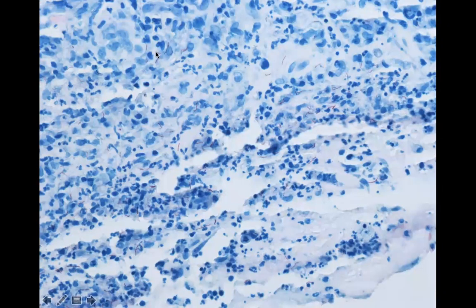And in this case, when we did the Fite stain, you could see the mycobacteria, but often if you do the special stains, the sensitivity only rises to about 18 to 20% in a study we did. Tissue cultures, you might only reach 35%. So if you really suspect infection, sometimes you have to go all the way to PCR and send your tissue to the CDC, which is part of how this outbreak was discovered, was because an astute pathologist at our laboratory kept sending them to the CDC, who alerted the public health department. But sometimes you're lucky and you can get organism in your special stain.